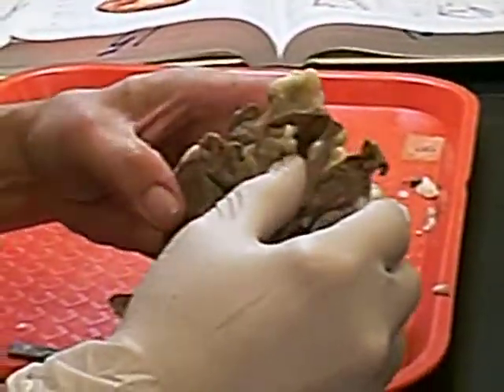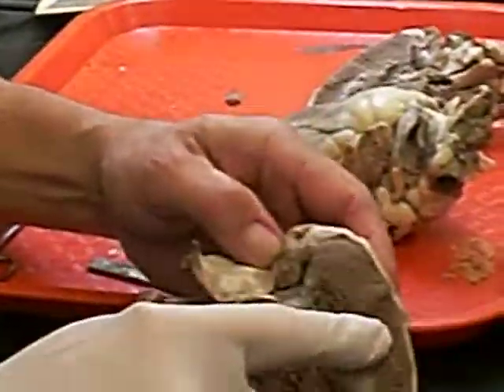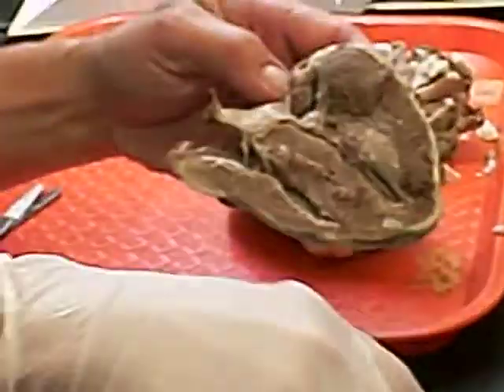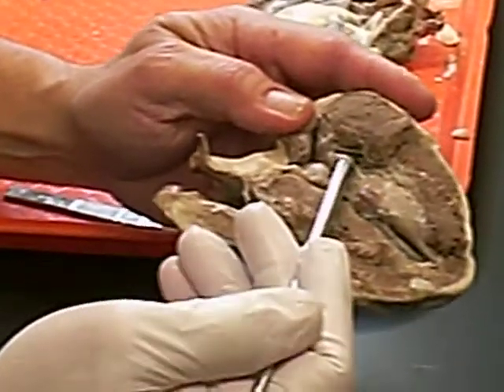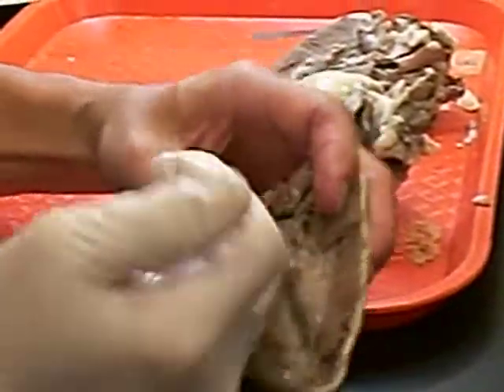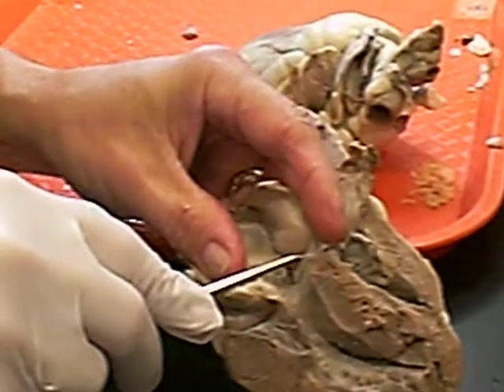Blood then goes to the lungs, comes back and returns to the back of the heart, to the left atrium. From the left atrium, we can tell the left side because the muscle is much thicker. This middle part is the interventricular septum — this myocardium on the left side is much thicker. Blood then goes through the bicuspid valve, which also has cordae tendineae and papillary muscles, into the left ventricle. It exits through the aorta, where there are three little flaps of tissue called the aortic semilunar valve.